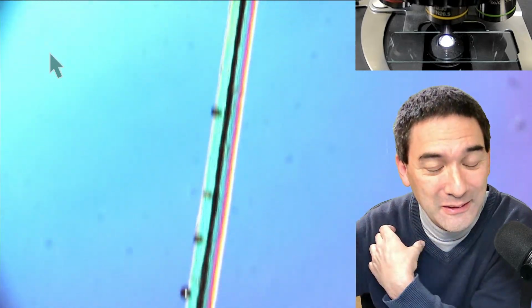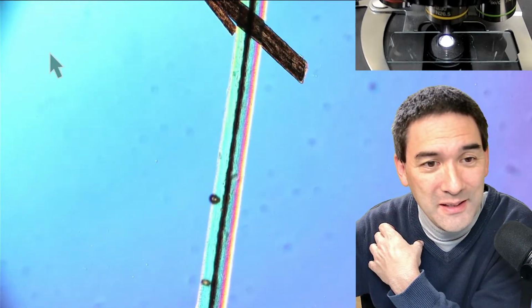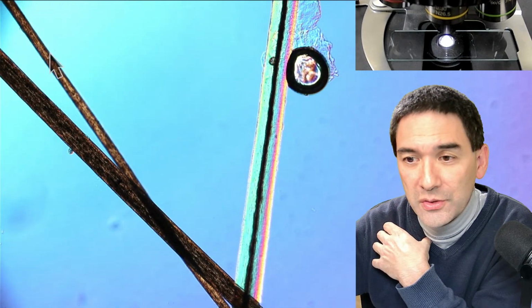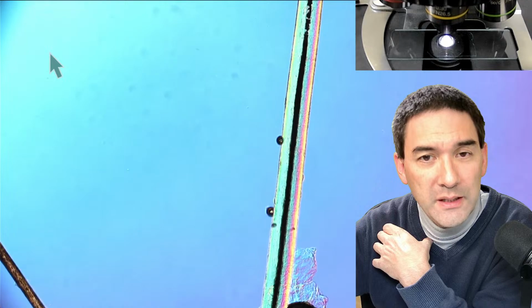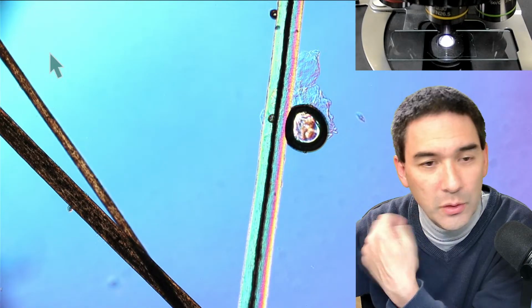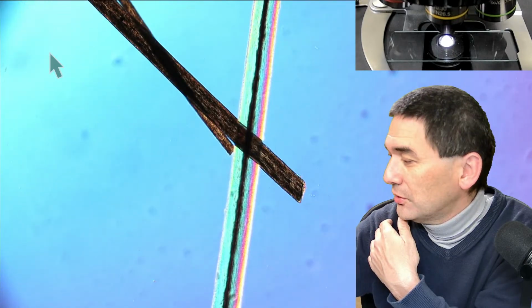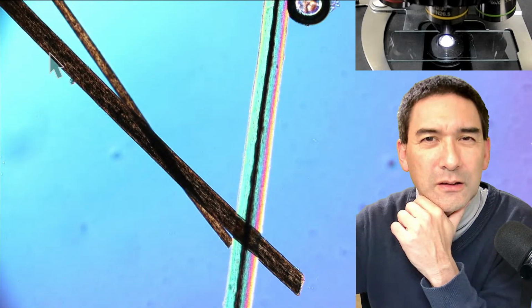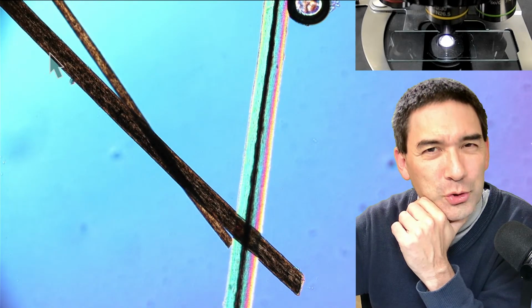So the contrast is quite intense here, right? What I want to quickly determine is the following. What time is it? I'm trying to always make a little time estimate. And I've been thinking a long time, should I show it to you or should I not show it to you?